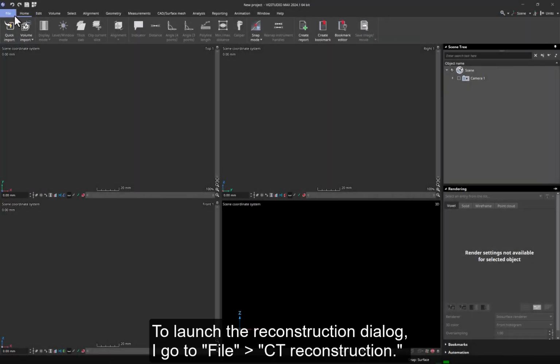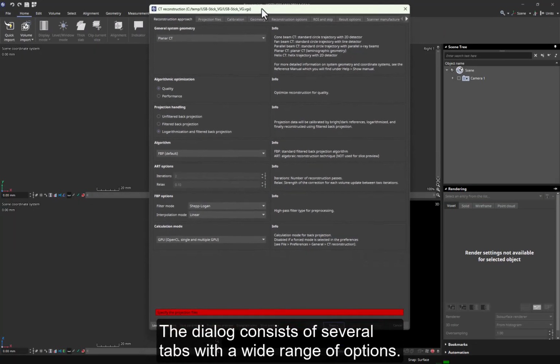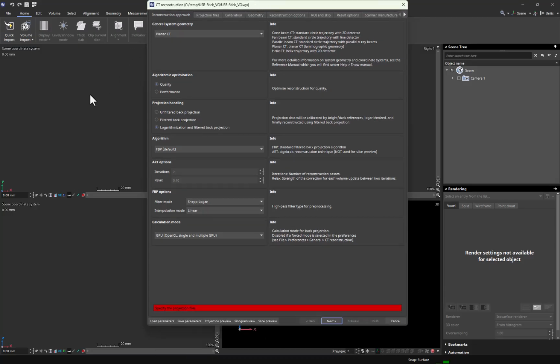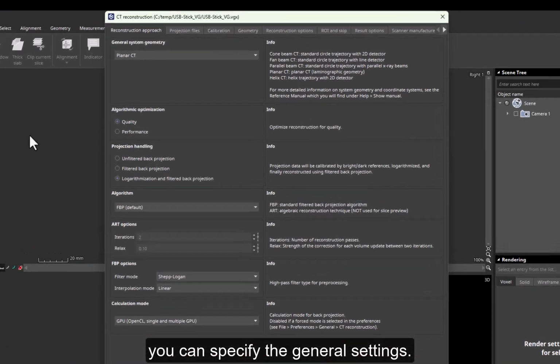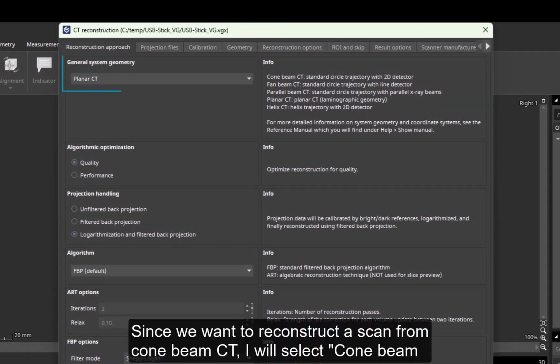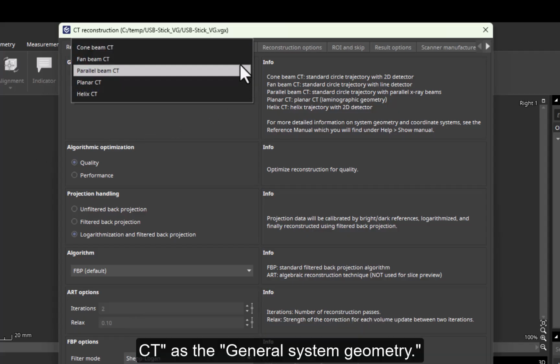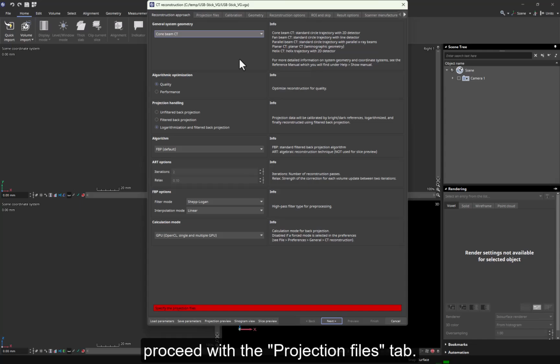To launch the reconstruction dialog, I go to File, CT Reconstruction. The dialog consists of several tabs with a wide range of options, but don't worry, we will only need a few of them. So let's start with the Reconstruction Approach tab where you can specify the general settings. Since we want to reconstruct a scan from cone beam CT, I will select cone beam CT as the general system geometry. For all other options on this tab, I can keep the default settings and proceed with the Projection Files tab.